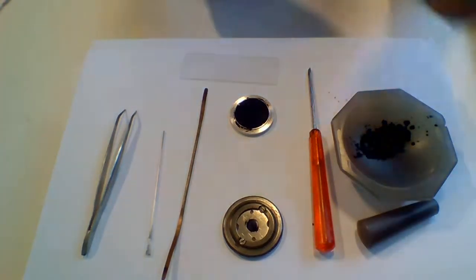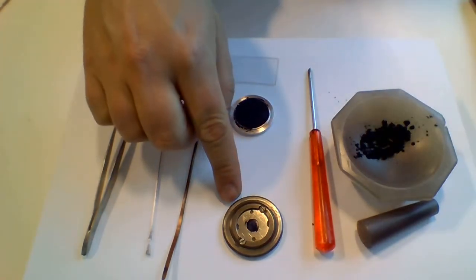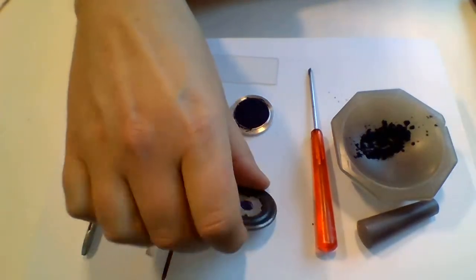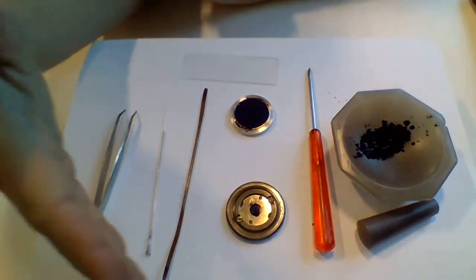I have made three short videos to demonstrate how to prepare samples for different diffraction setups. We have the STOE transmission geometry, so the idea is that the beam is shooting through the sample and detected on the other side.